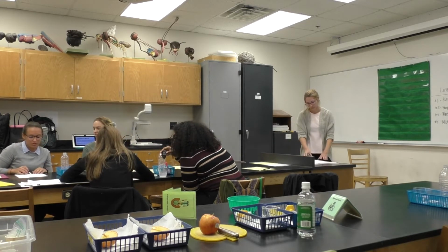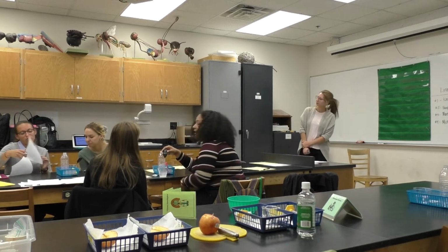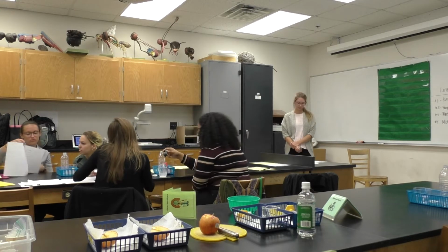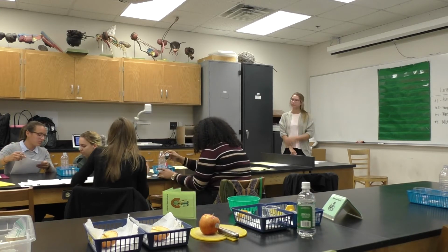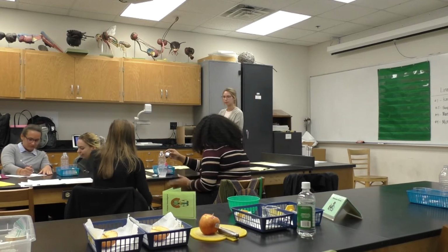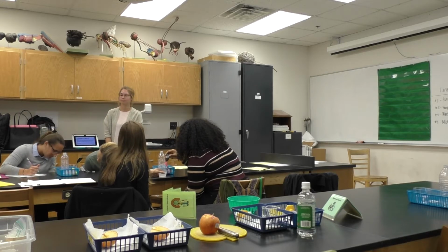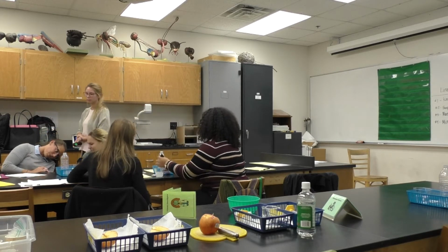Anything else, any other observations? Is the tip dropping? I didn't realize it was that close. You can't really feel it with the cup though. It's not as clear. It's bubbly.